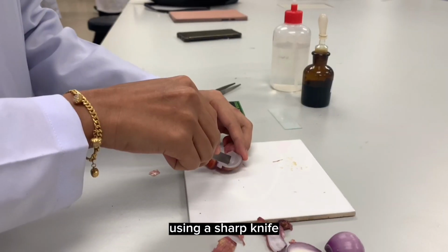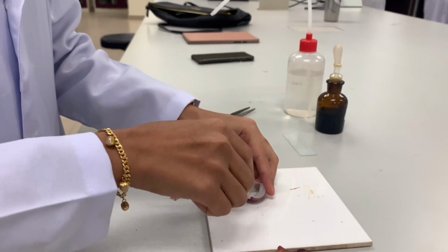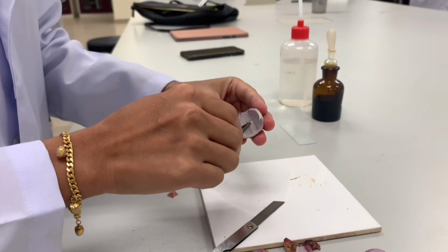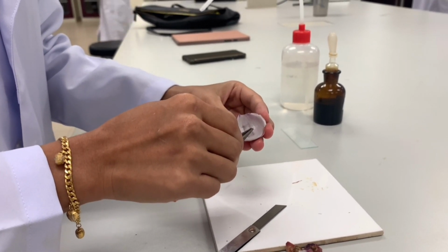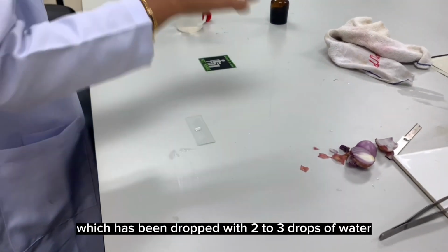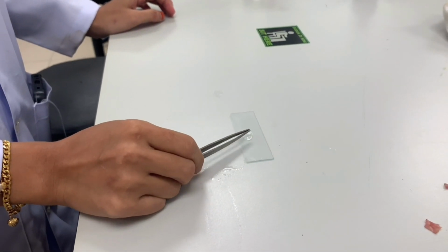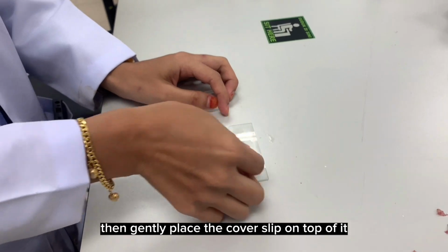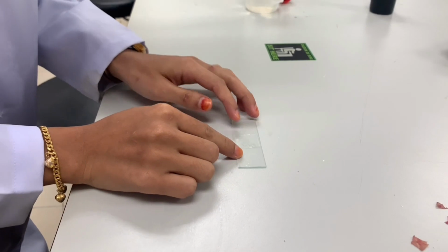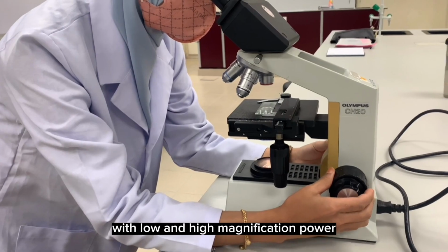Using a sharp knife, peel a small portion of the epidermis layer of the onion. Next, place the epidermis layer on a slide which has been dropped with 2 to 3 drops of water. Then, gently place the cover slip on top of it. After that, observe the slide under the microscope with low and high magnification power.